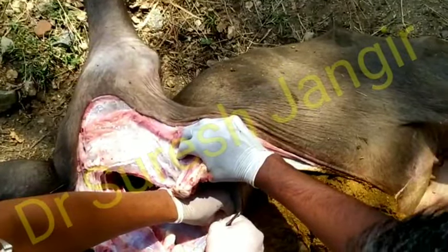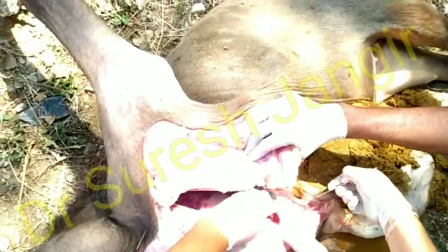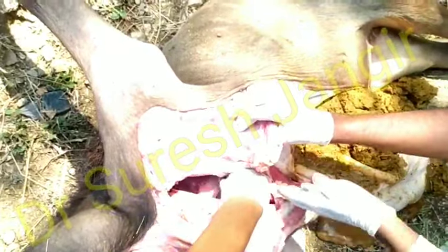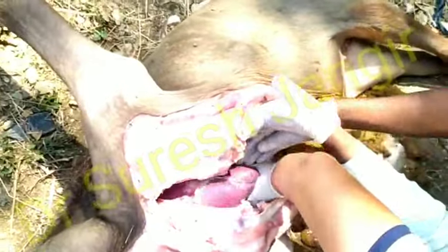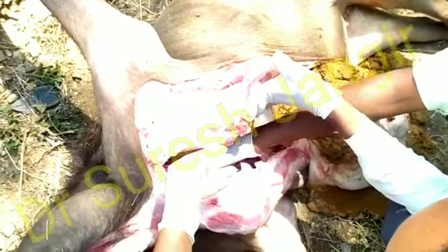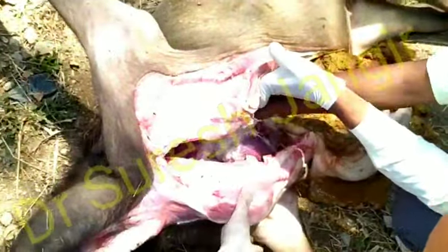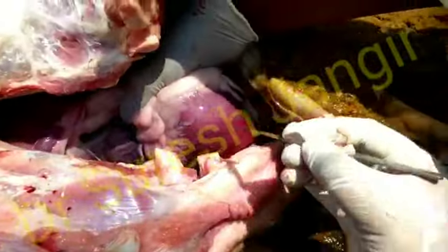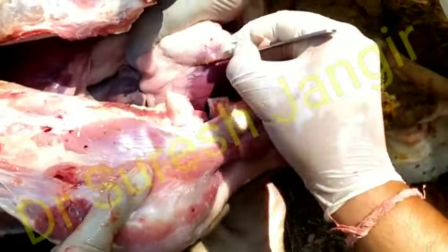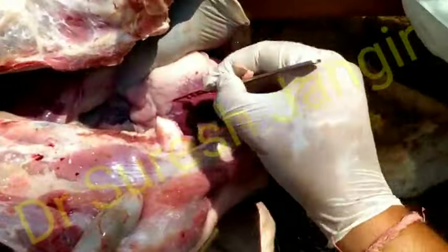We have to open its heart. We can see here the heart of the buffalo. We have to open all of its chambers. First of all, we have to open its atrium. On opening of the atrium, we found clotted blood here. On pressure, the clotted blood is oozing out. This is the clotted blood from the atrium.